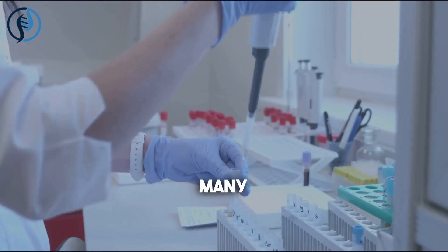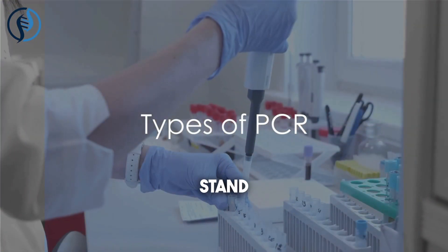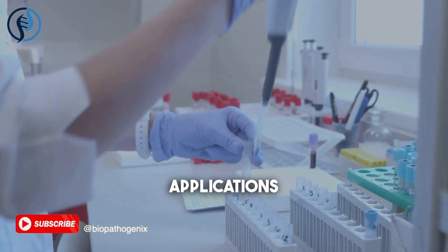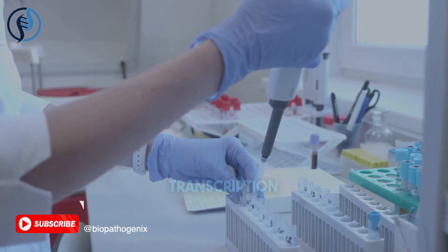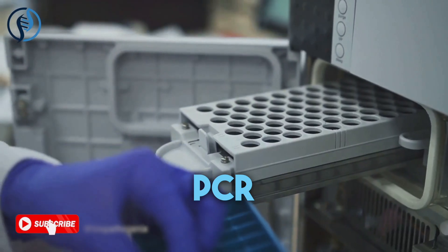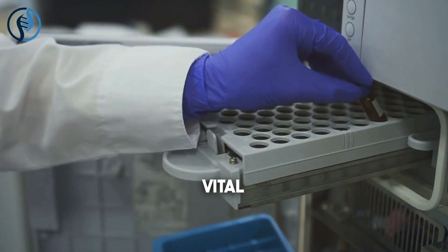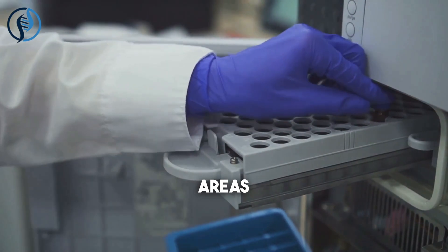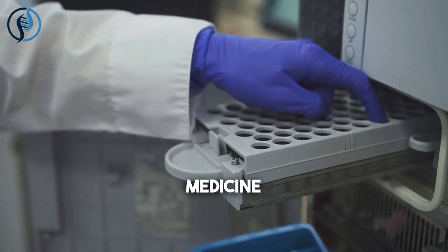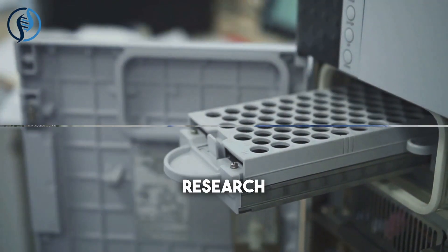Among the many different forms of PCR, three stand out for their unique characteristics and applications – reverse transcription, nested, and digital PCR. Each plays a vital role in areas ranging from forensic science and medicine to biotechnology and research.